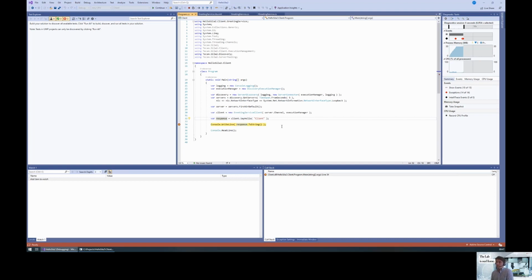And this works not only for responses, it also works for parameters. So we can also just put the dynamic object property as parameters, and that would also work. Yeah, and this is basically how you can work with the AnyType with the Tecan SiLA 2 SDK.